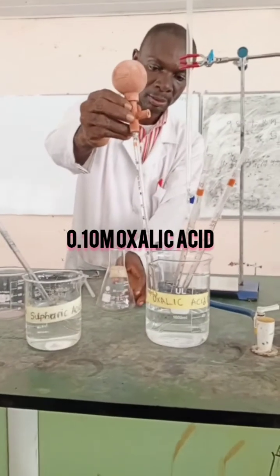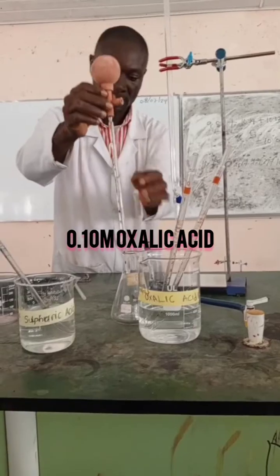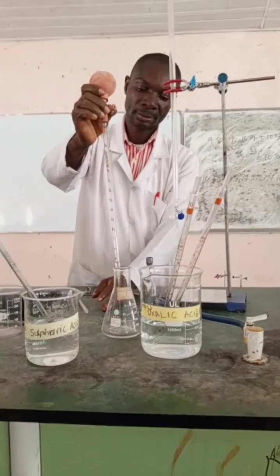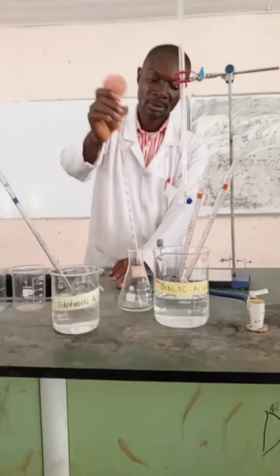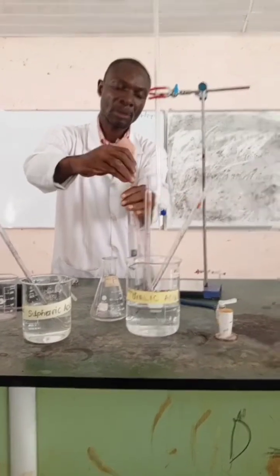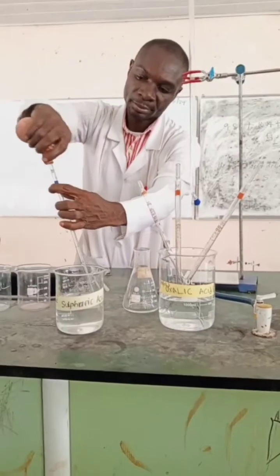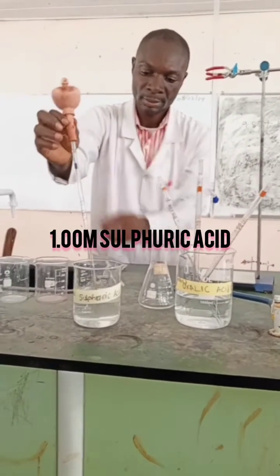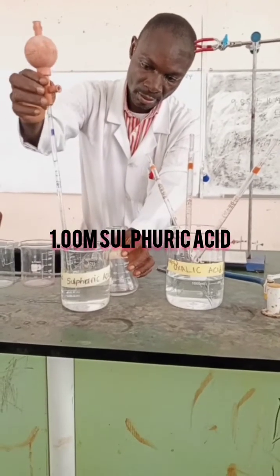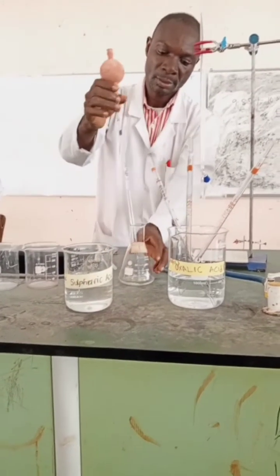10 ml of 0.10 molar solution of oxalic acid, which is one of our reactants, will be prepared into our conical flask carefully. Remember not to force out the last drop of the solution from the pipette, because it is calibrated that way — the last drop is not part of the measurement. Then use a pipette to measure 5 ml of sulfuric acid, also prepared into the conical flask containing the 10 ml of oxalic acid.